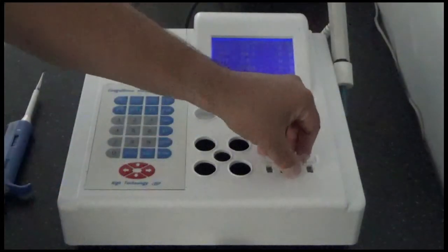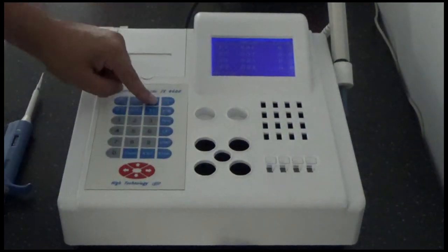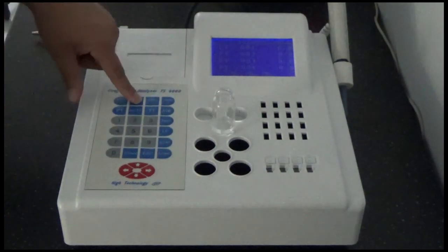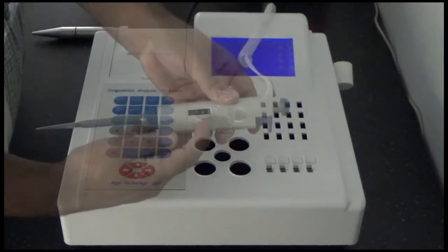When the cuvette is ready, place it in the testing chamber and start the timer for each well. The timers are set for 3 minutes. When the timer is finished, the buzzer will sound. Press each timer button again so they stop.